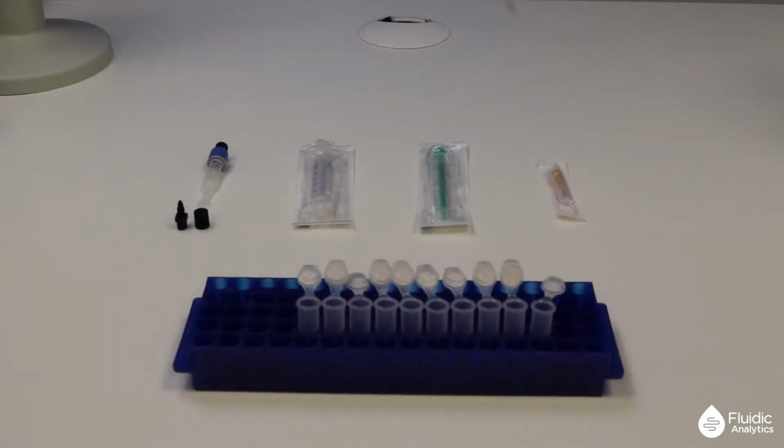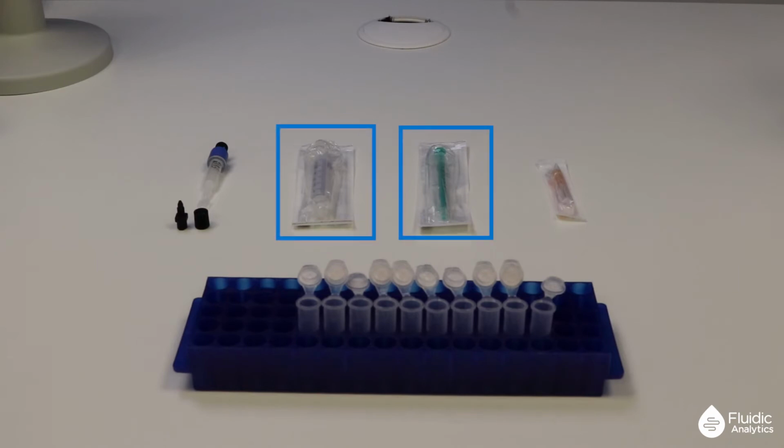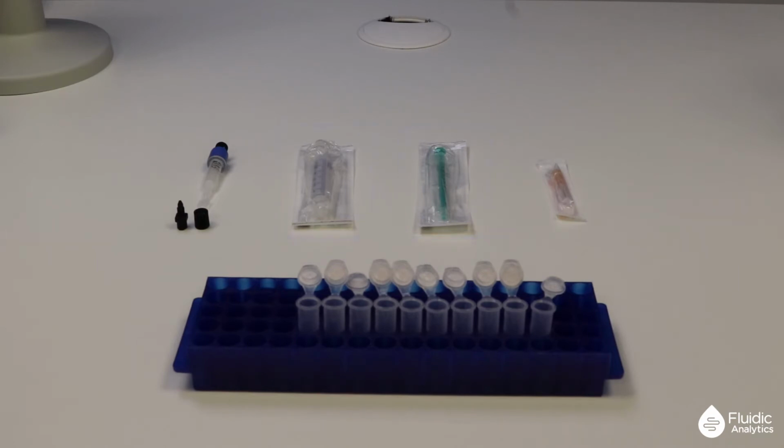After overnight reaction, the chemical labeling will have taken place and it is now time to purify the labeled protein away from the free dye. To do this, we'll use a 1 ml Pierce desalting cartridge and the connector that comes with it. We'll also need a 5 ml and a 1 ml syringe, a needle and 10 microtubes. Finally, we also need a buffer to transfer the protein into.